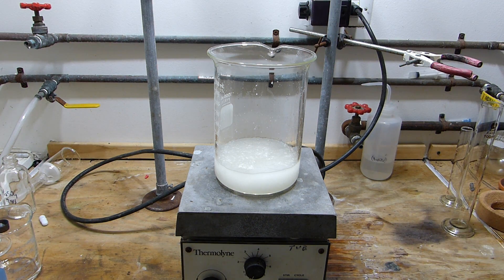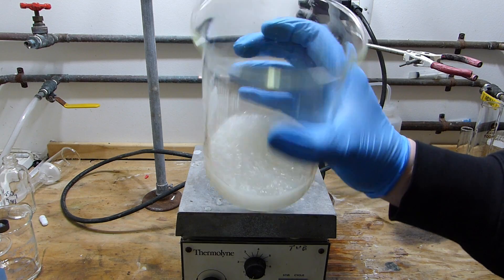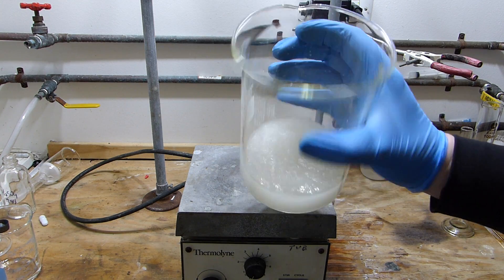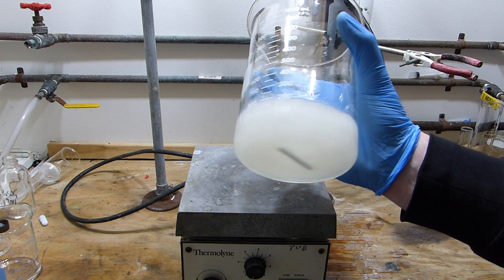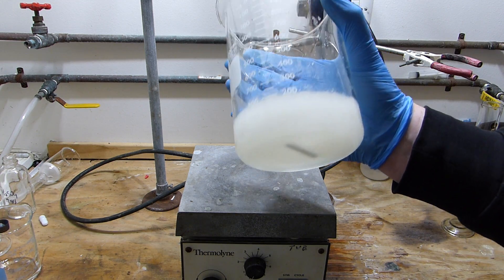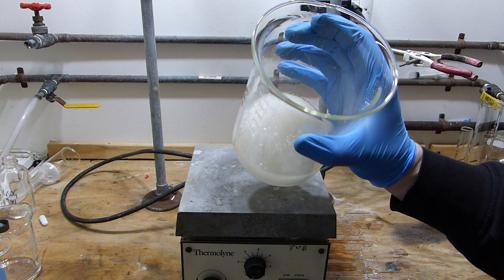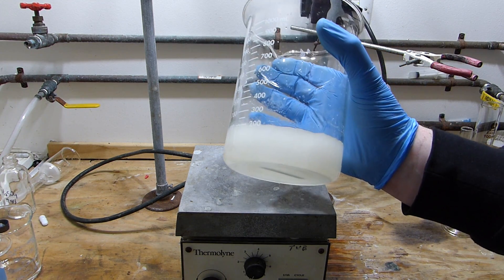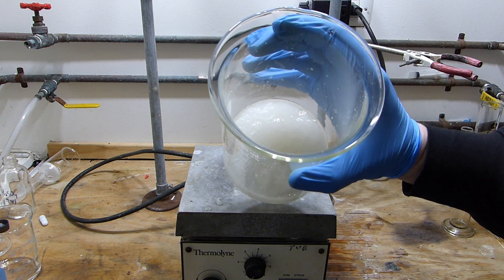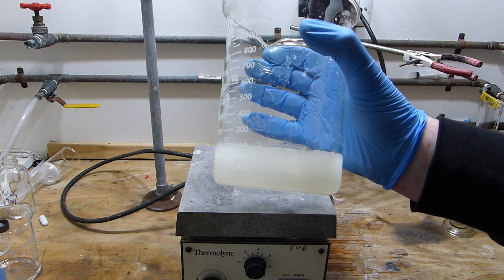All right, so after about an hour of stirring and cooling, you can see that this has crystallized into a solid mass. I'm just going to pop this into the refrigerator really quickly to get it cool, which will cause the crystals to precipitate as much as they possibly can, at which point I can break this up and then vacuum filter the product.